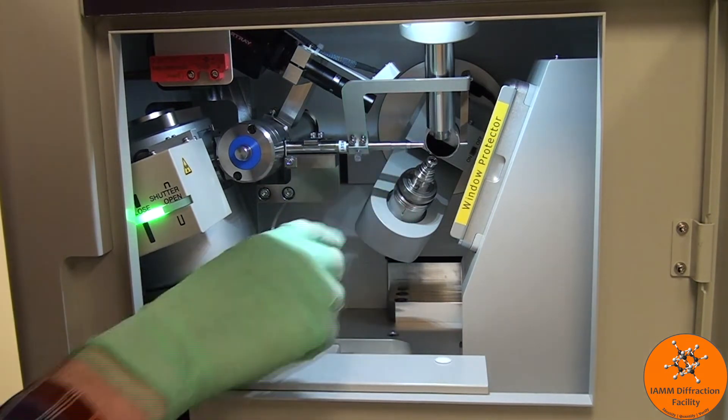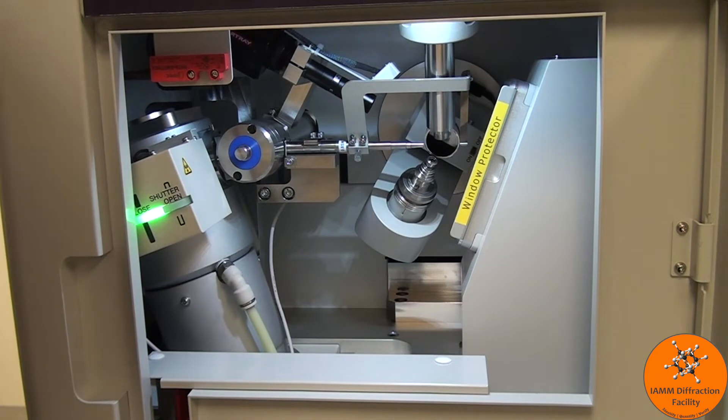This back here sucks in all of the nitrogen gas as it is coming out so that it's not just shooting down all the way into the chamber.